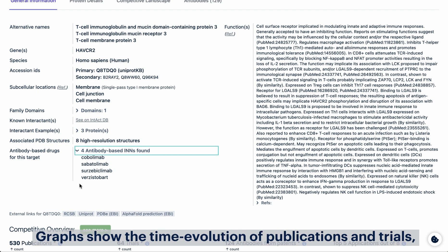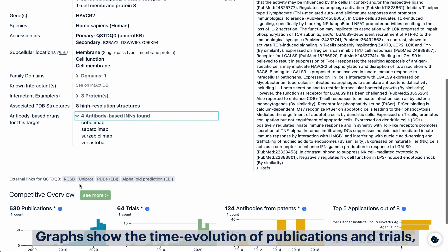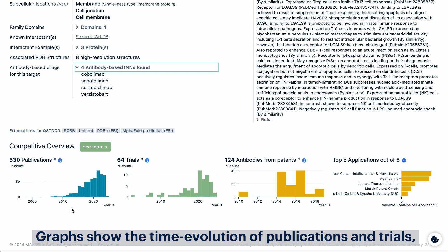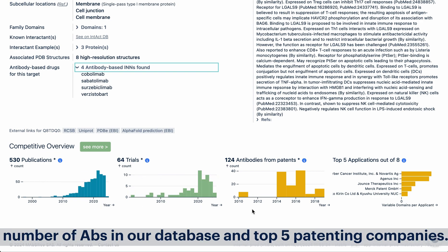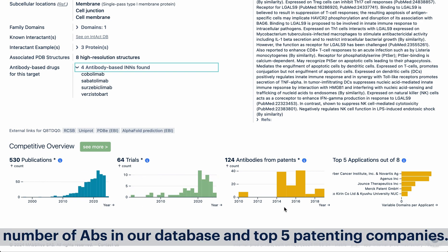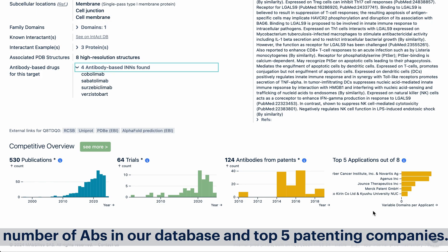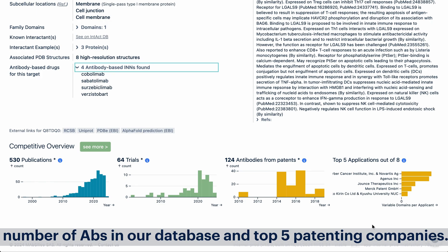Graphs show the time evolution of publications and trials, the number of antibodies in our database, and the top 5 patenting companies.